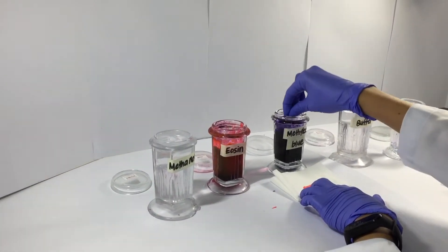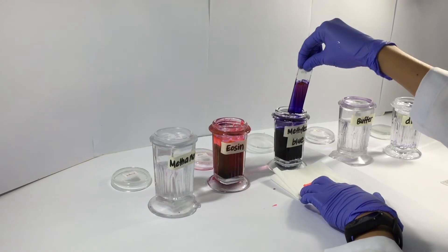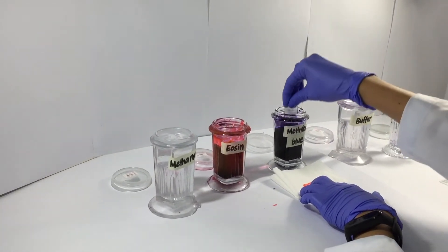When a purplish color appears, then you can dip it into the buffer for 45 seconds, and then rinse with water.